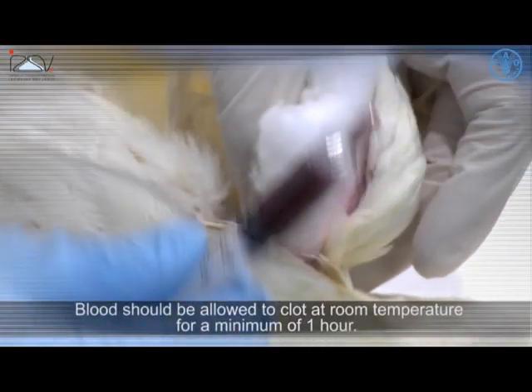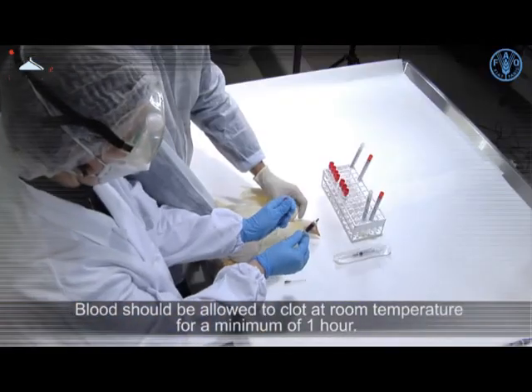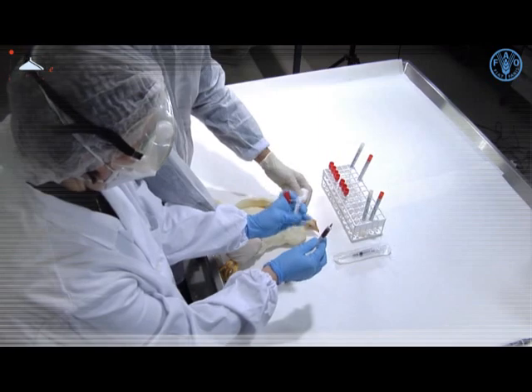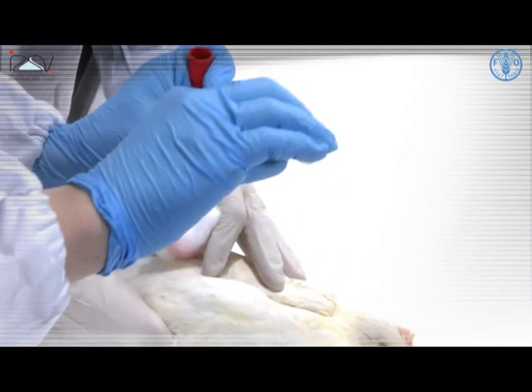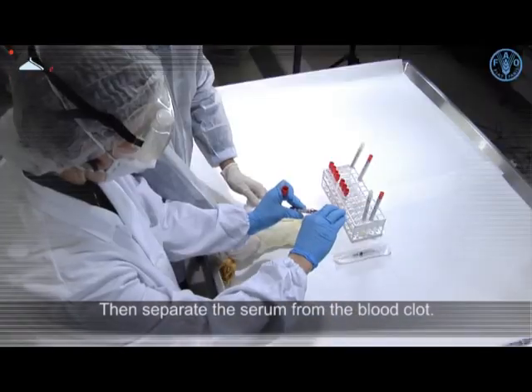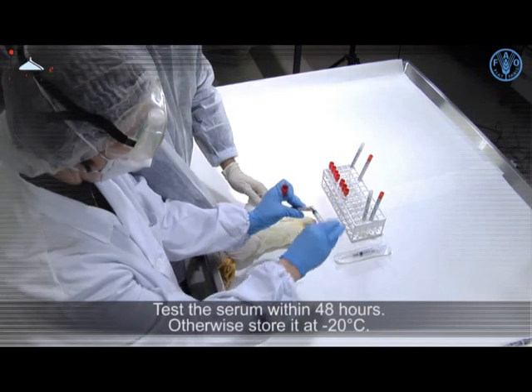Blood should be allowed to clot at room temperature for a minimum of 1 hour. Separate the serum from the blood clot. Test the serum within 48 hours.